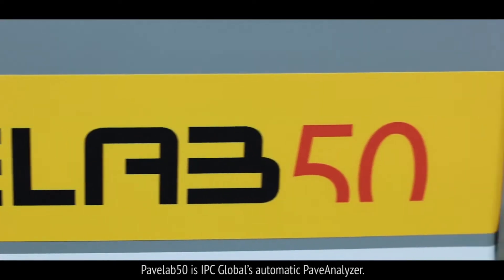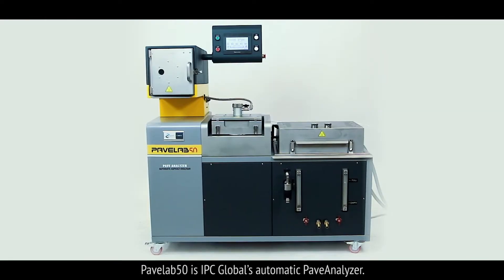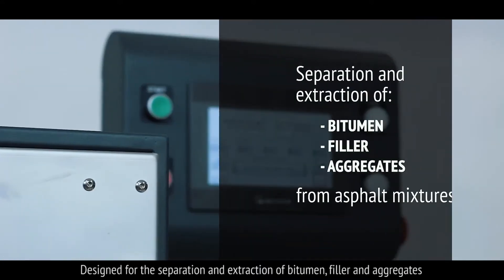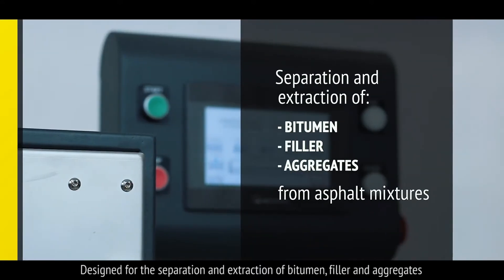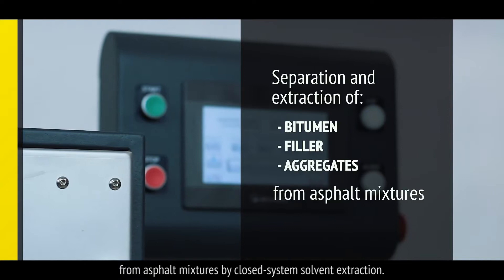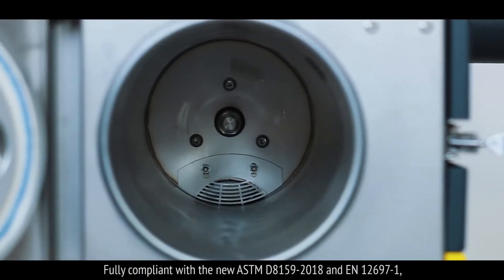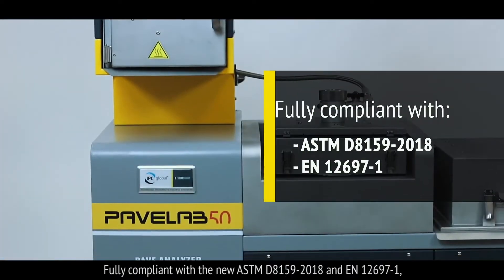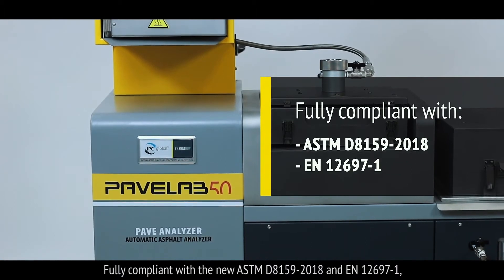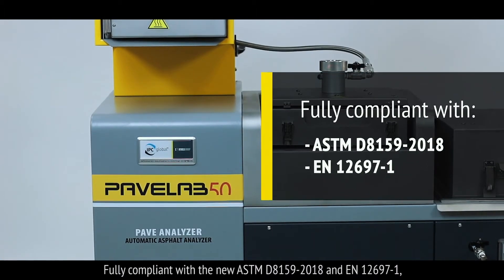PaveLab 50 is IPC Global's automatic pave analyzer, designed for the separation and extraction of bitumen, filler and aggregates from asphalt mixtures by closed system solvent extraction. Fully compliant with the new ASTM D8159 2018 and EN126971.